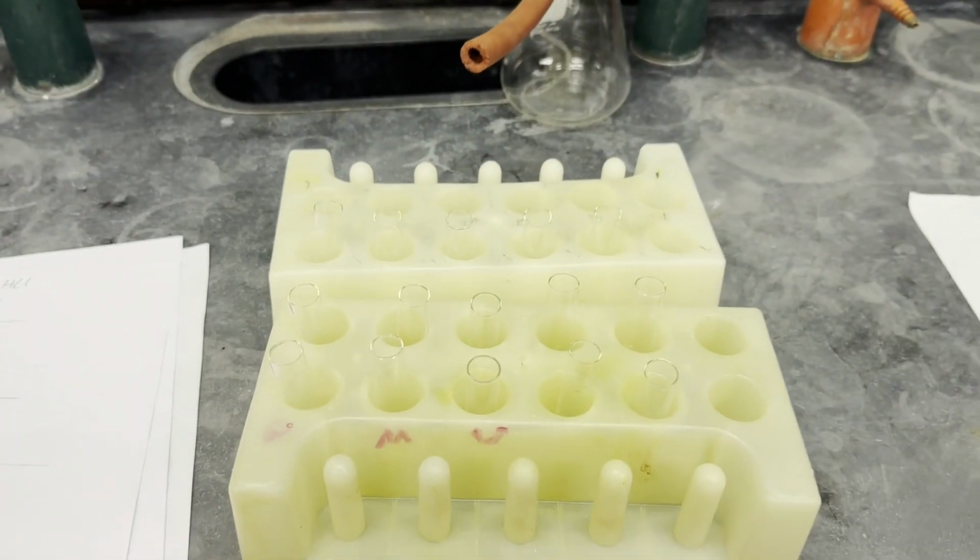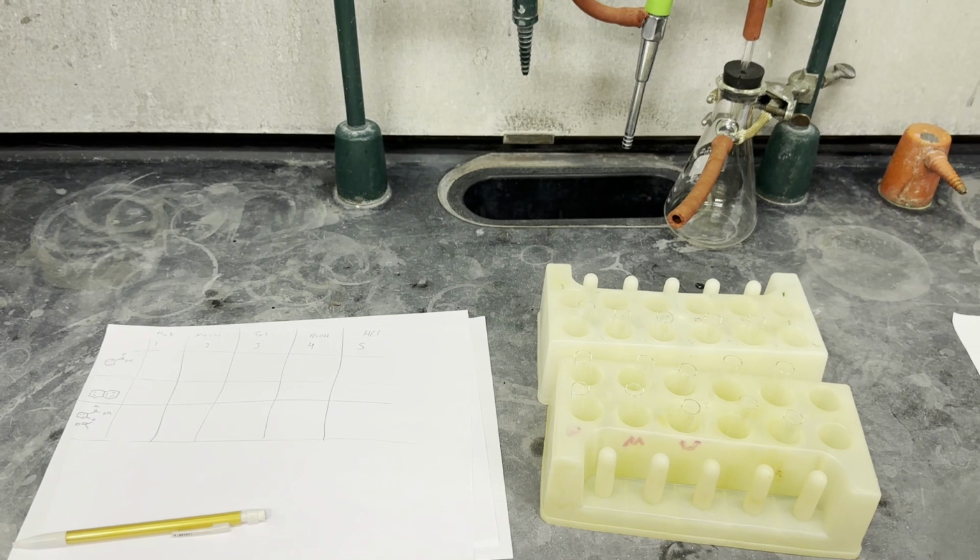So I've gone ahead and done that here, but I'm not going to show you the results, so you can do it yourself.